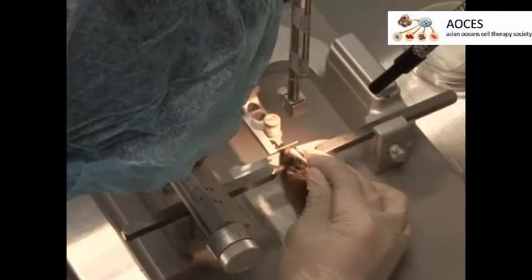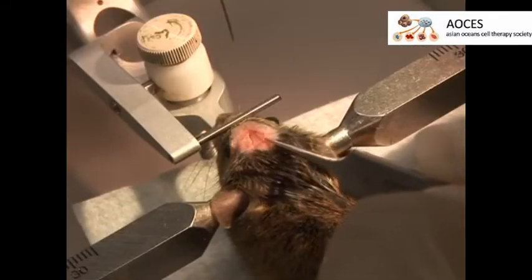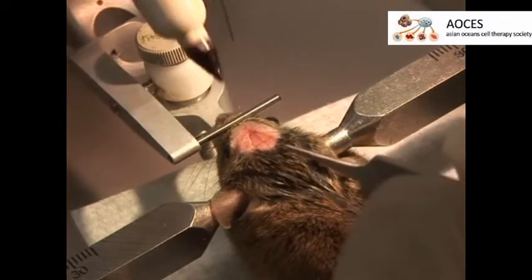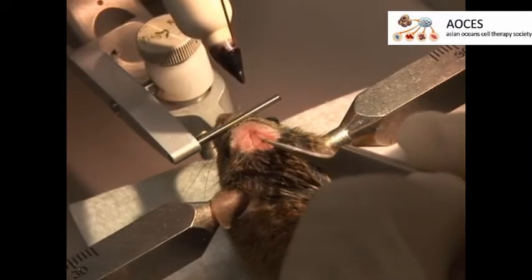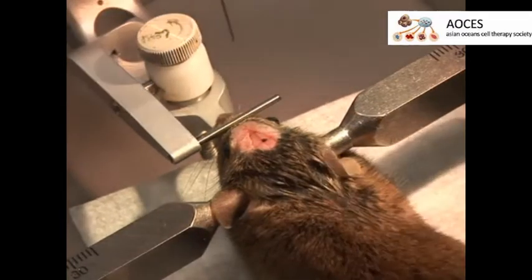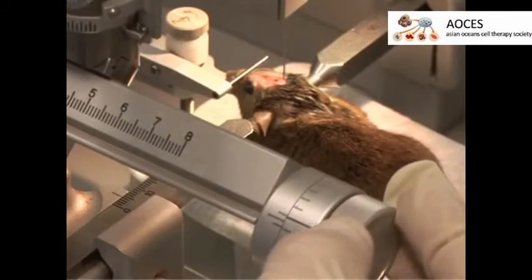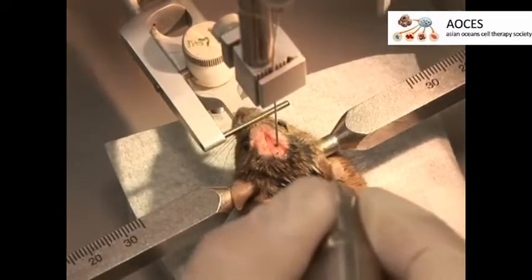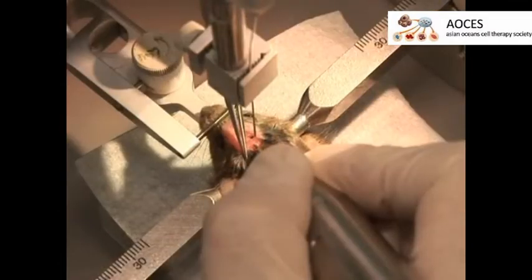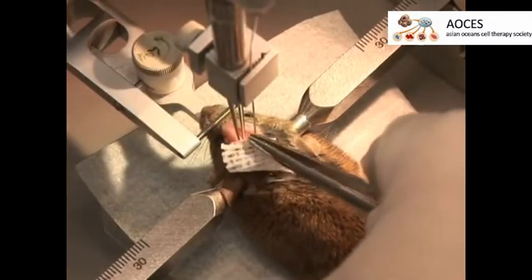Clean the skull with 3% hydrogen peroxide. Then, identify bregma, where the sagittal suture intersects the coronal suture on the skull. Measure 2.9 mm posterior and 0.5 mm lateral to bregma and mark this point. Carefully drill a small hole at the point of the second mark. During drilling, apply saline to the site where the hole is drilled to prevent secondary heat injury.